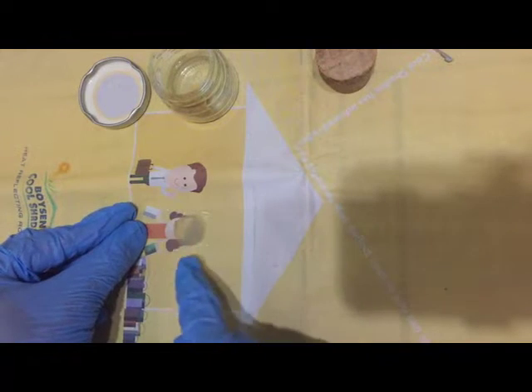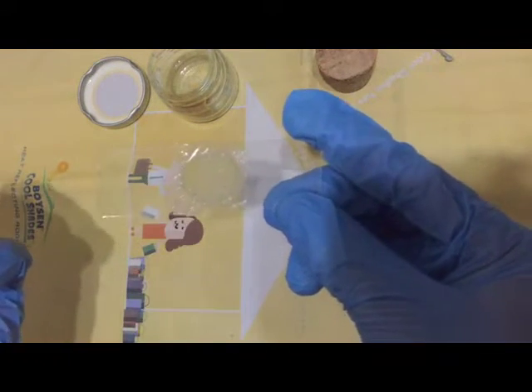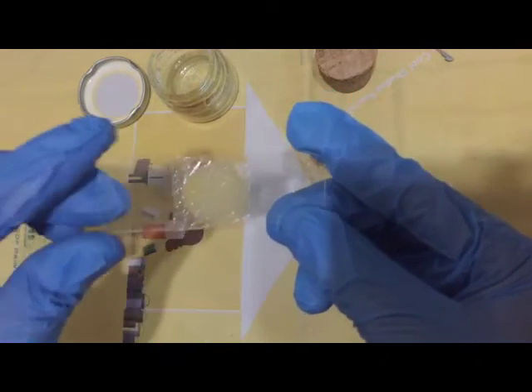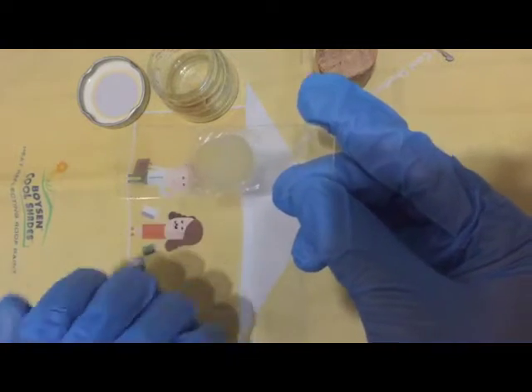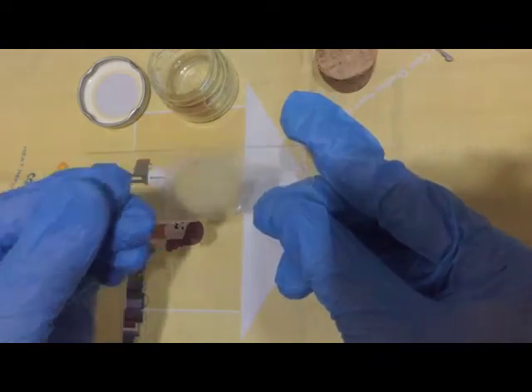This is to make sure that you'd be able to visualize something from the stool sample. If the stool is thick, then light from the microscope won't be able to pass through and you won't be able to see anything from the glass slide. That's why you need to flatten it out.